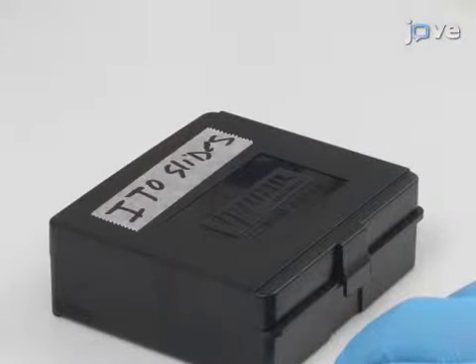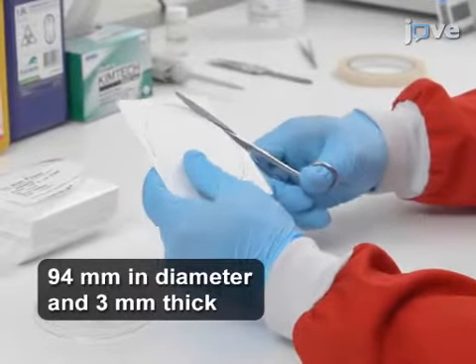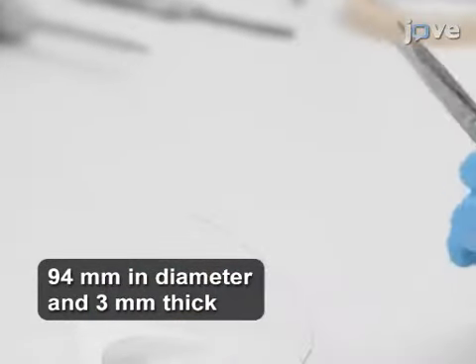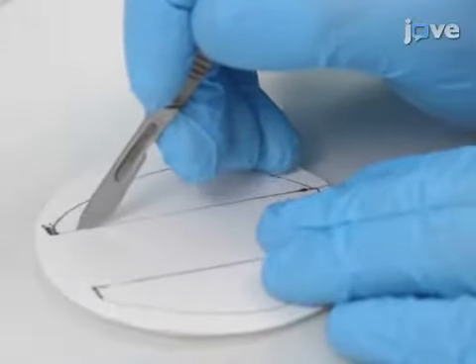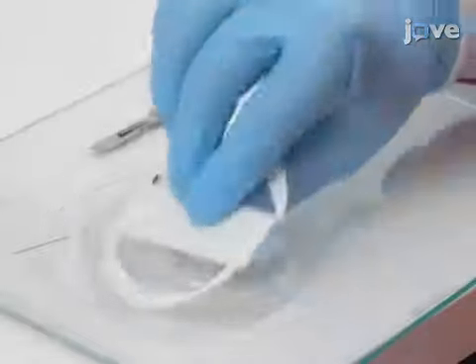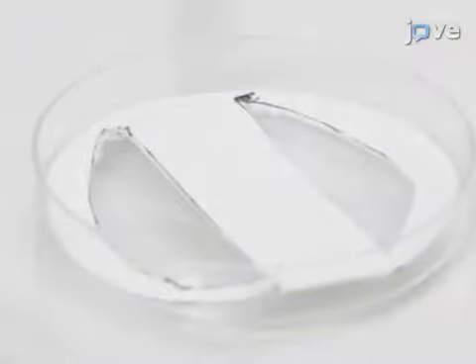at room temperature. Next, create custom vapor chambers by cutting a piece of thick blotting paper big enough to fit the bottom half of a standard plastic petri dish. Cut the paper to leave a rectangular strip in the center the same size as a microscope slide. Leave enough excess so that the paper will maintain its position in the petri dish.